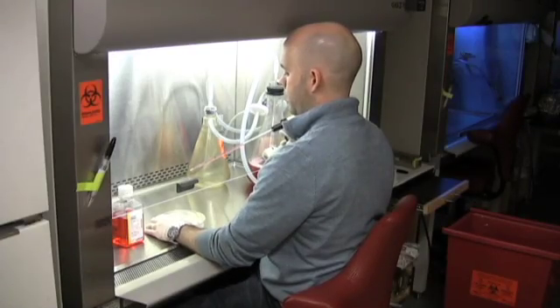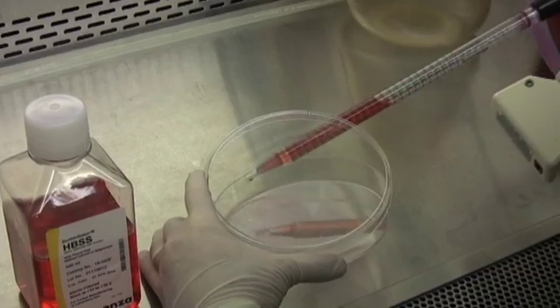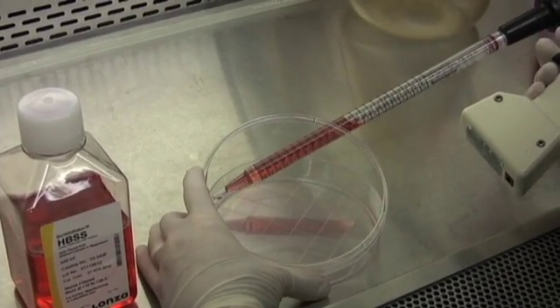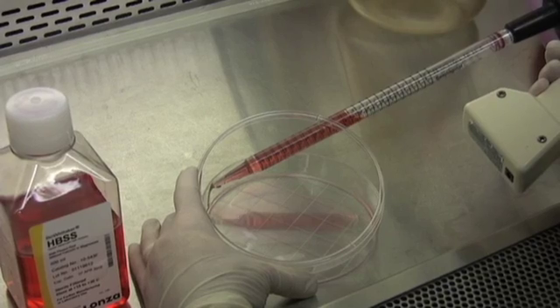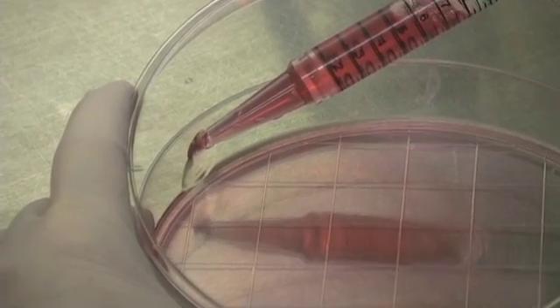Now when adding you want to grab the plate again, open it slightly, and add media to the wall gently so as not to disturb the cells that are adhering to the dish.